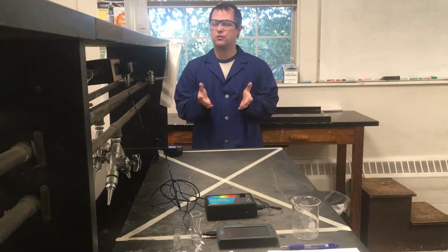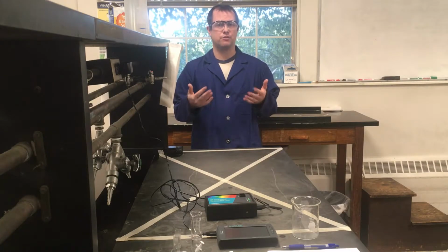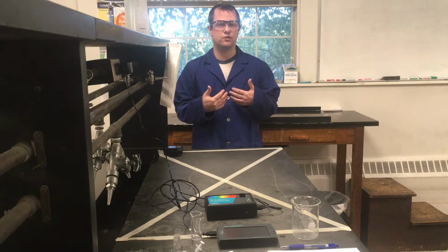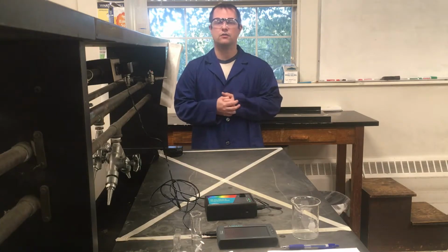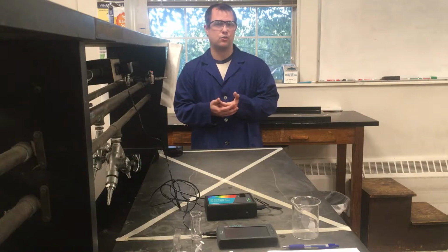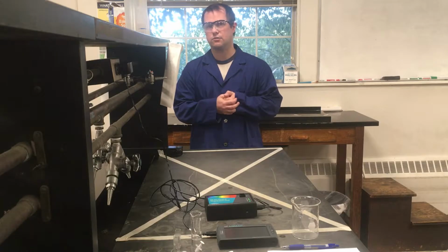What we're going to be taking a look at this week is something called Beer's Law, which is maybe something a little unusual from what you're used to in lecture. It deals with the absorbance of a particular solution, trying to figure out where a particular solution or compound absorbs best, and using that information to help us figure out unknown concentrations.